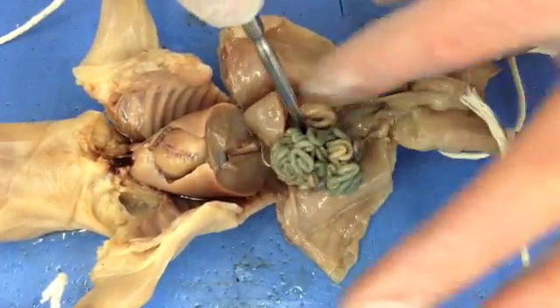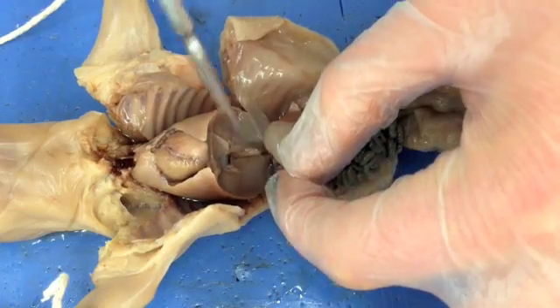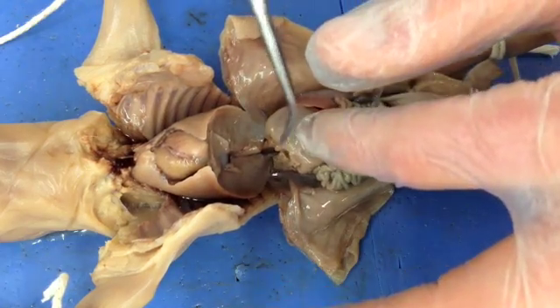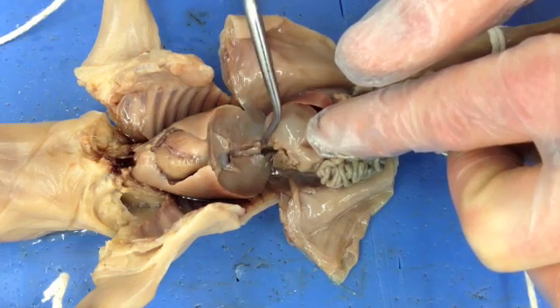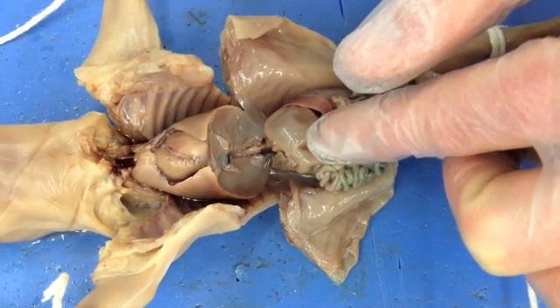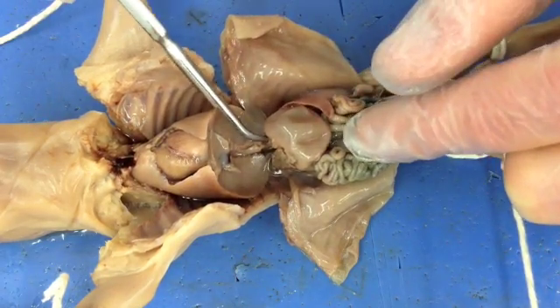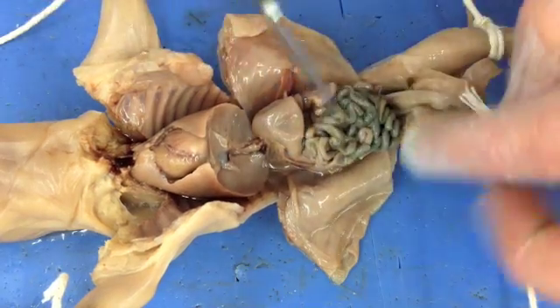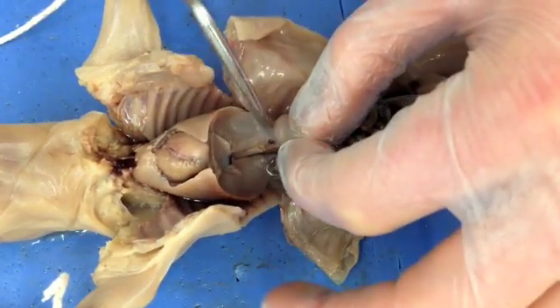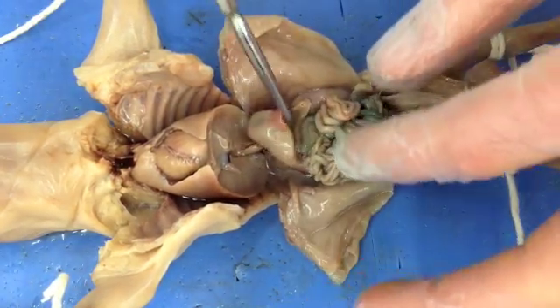Now I'm going to remove some of these organs — I'll cut back and remove the stomach. You can see up here there's a tube coming down; this is actually part of your esophagus. Food goes through your mouth, down the esophagus, all the way down behind the lungs and enters into your stomach. Then from the stomach it goes to the small intestines, large intestines, and out of the body. I'm going to remove the stomach and spleen, and when I get those out I can give you a better view of the pancreas.